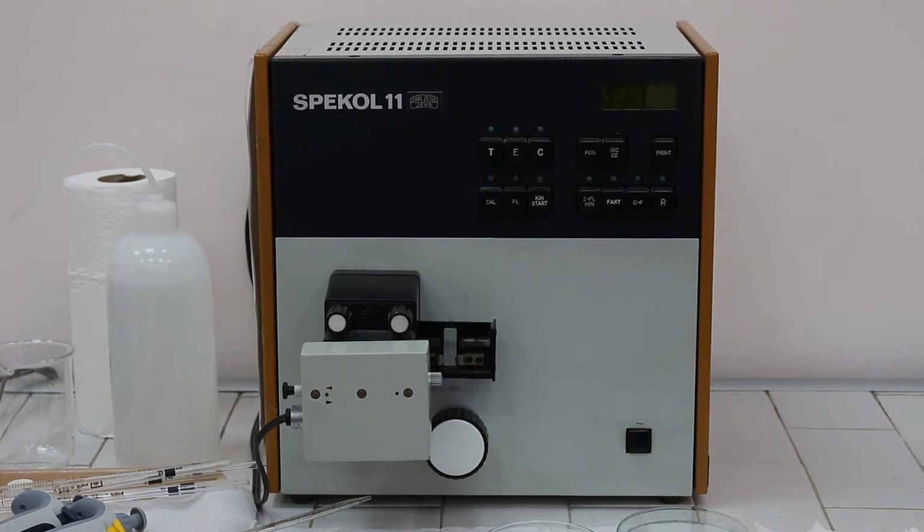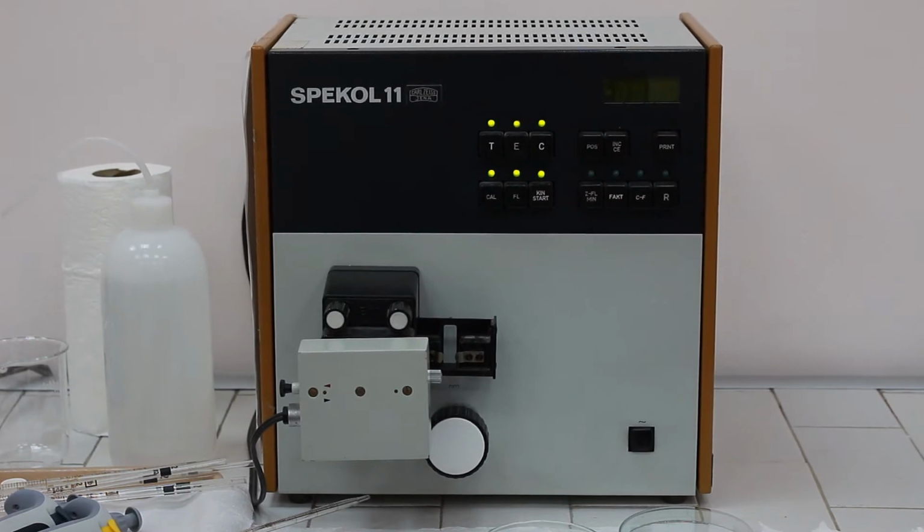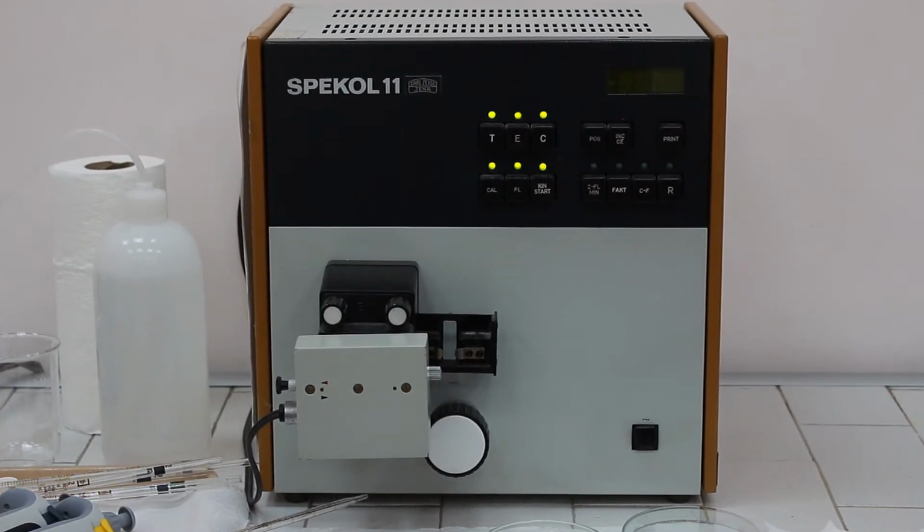Determination of the initial rate of alkaline phosphatase activity from serum sample. This is the photometer, which is actually a spectrophotometer, the instrument which is used whenever we need to observe and measure at wavelengths which are below the visible part of the spectra, because this instrument is equipped with a UV or ultraviolet light. These instruments are really abundantly used in biochemistry because most of the biomolecules and metabolites actually absorb in the UV part of the spectra. What is the principle of handling this instrument?